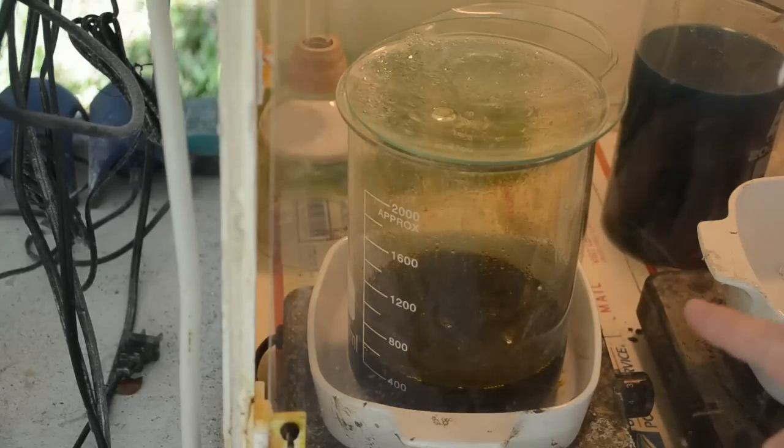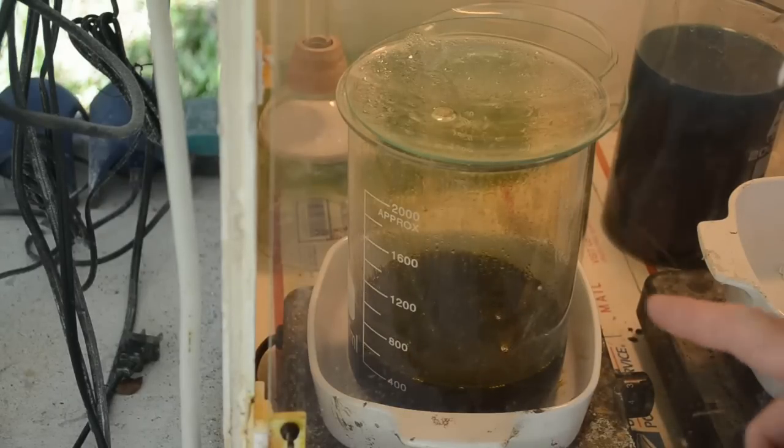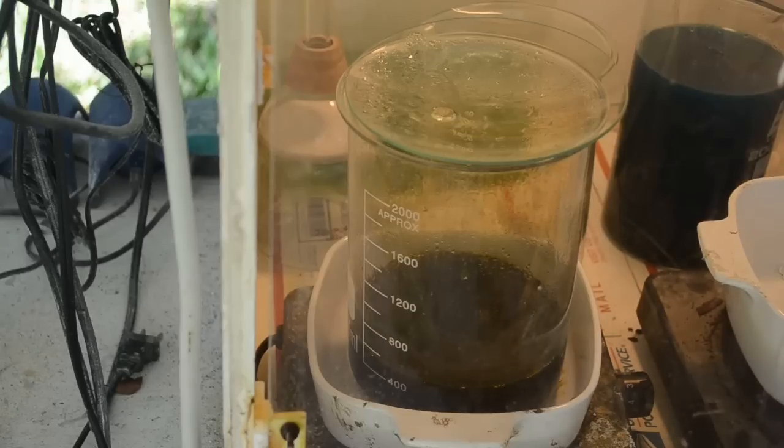Went to lunch and came back. I think the reaction is pretty much done in here — a little boiling, but I don't really see any more fumes. I'm going to move this to the back of the fume hood and grab a couple more big beakers to divide up the material that went through the sluice. I'll start treating them with nitric acid just like I did with this stuff — dissolve off the bulk of the copper and other base metals — and then hit that stuff with aqua regia to see if we get some good gold out of it.